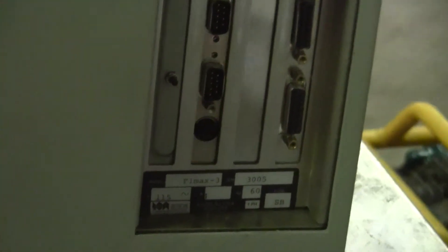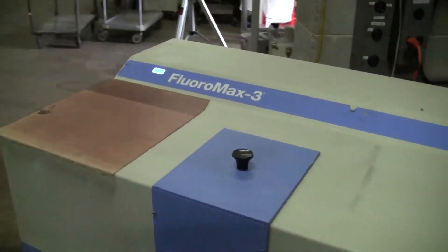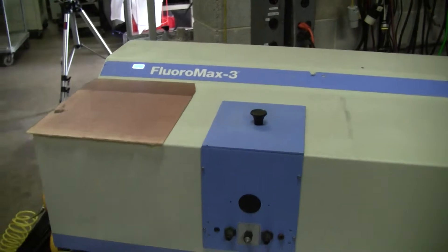There's an accessory board right here. We've got this wonderful specs light that came up. However, without the software we really can't do much more.